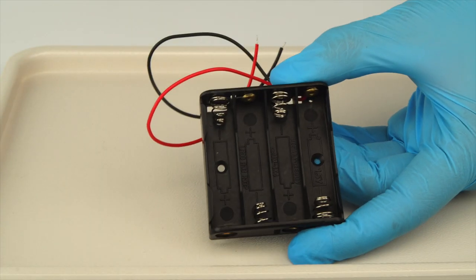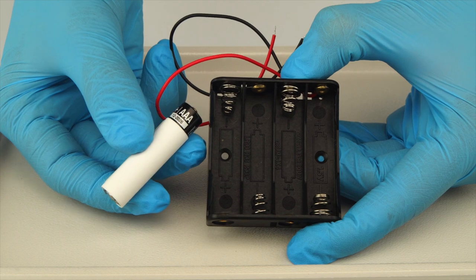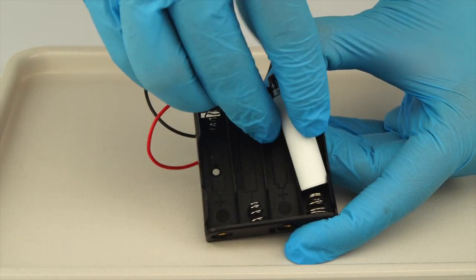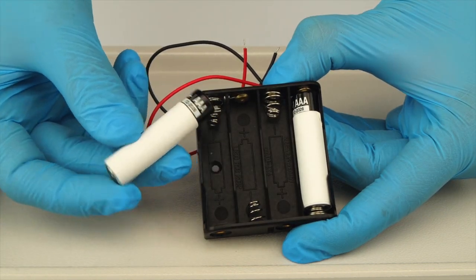Put your power supply together. Insert the batteries into the holder. Make sure to pay attention to their polarity and don't connect the wires to each other.